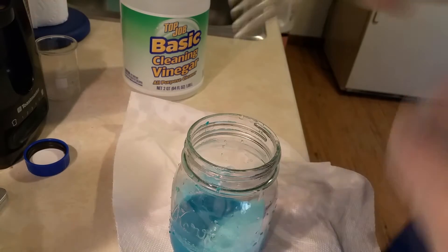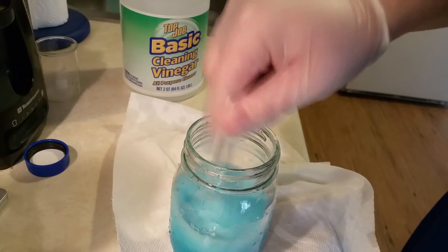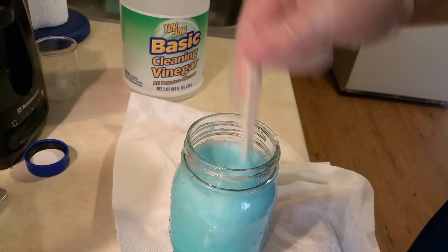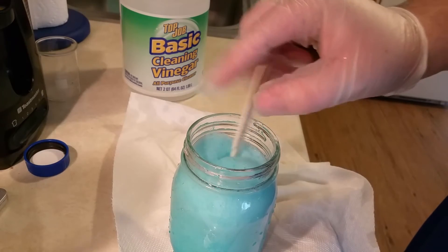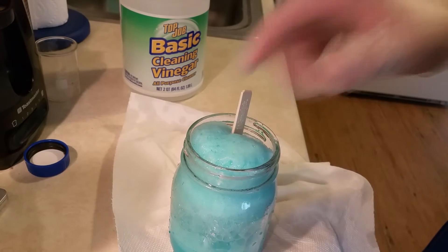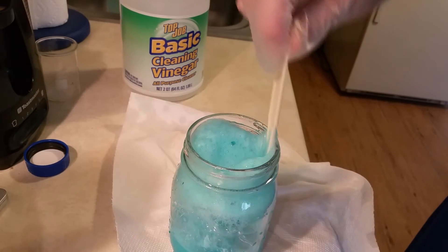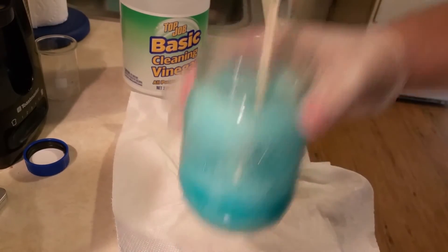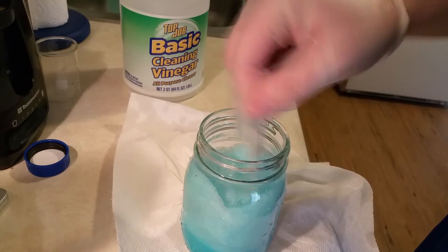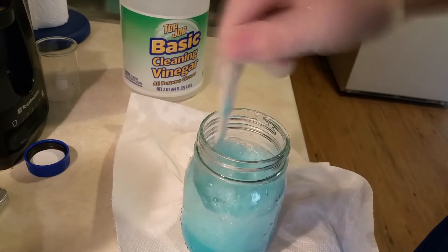This is more of a how-to-do-this-at-home video than a formal lab video with expensive glassware and stir bars. As you can see, if I don't stir there's a lot of CO2 release and it foams up. Carbon dioxide is produced because vinegar reacts not only with our copper carbonate to release CO2, but also with any excess sodium bicarb remaining in the container.